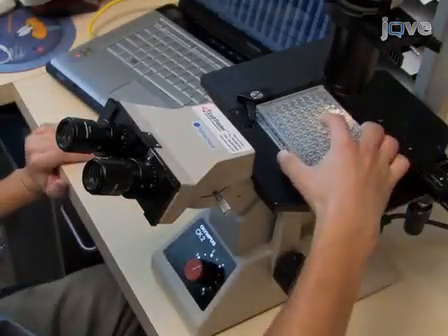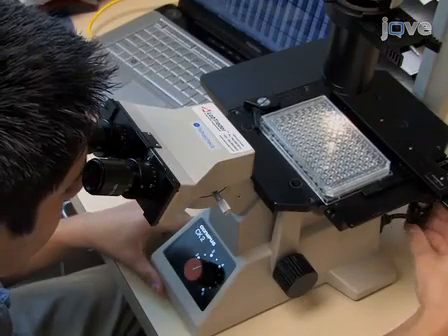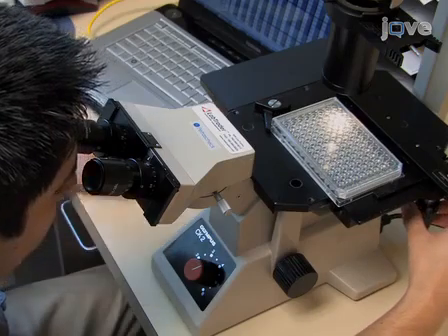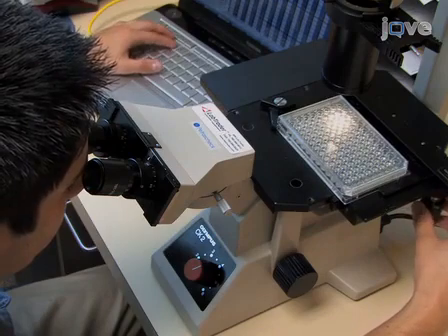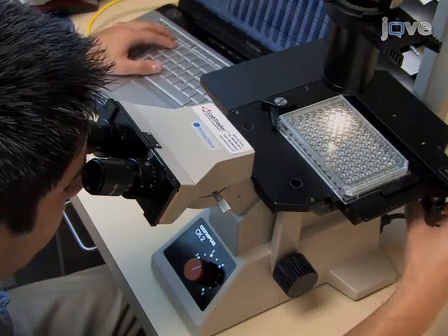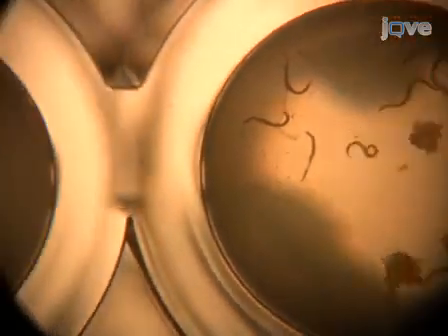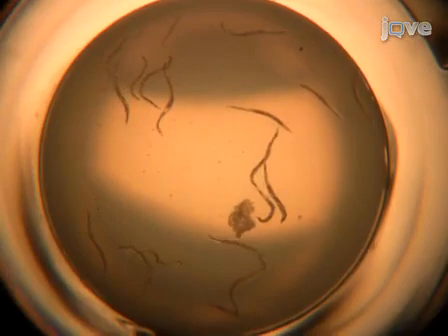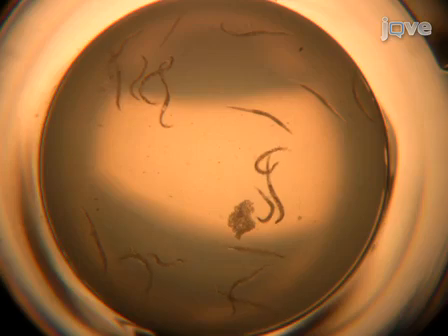Worms are scored for lifespan by their movement 3 times per week from the beginning of the experiment until they die. Use an inverted microscope with a 2x or 2.5x objective to observe worms in 96 well plates. On day 0 at the beginning of the experiment, count the total number of worms in each well. Censor wells that contain more than 18 animals from the analysis, as animals in these wells will not have enough OP50 and will show effects of dietary restriction.